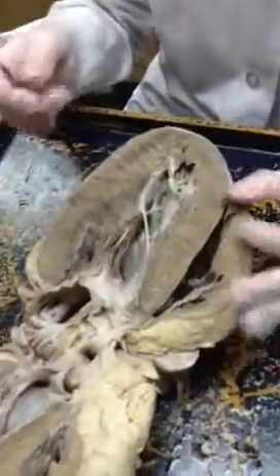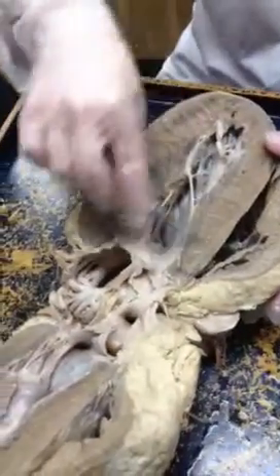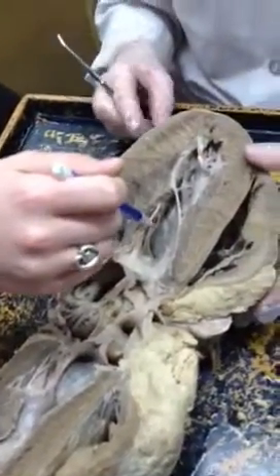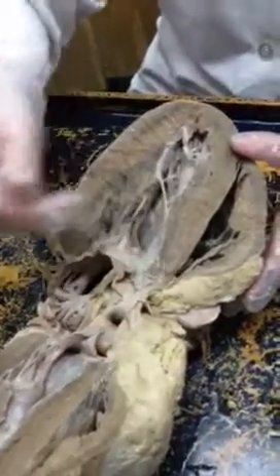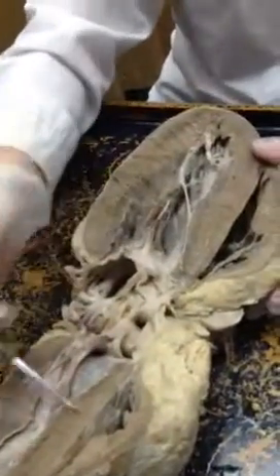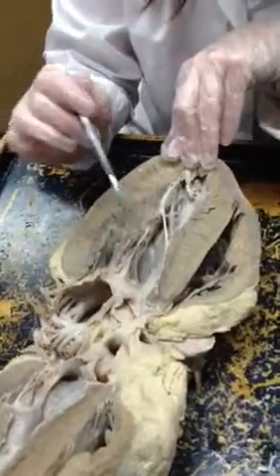When we open it up, you also have to be able to tell left versus right, because you'll have to identify specific chambers — left versus right ventricle and atrium. If there's a card that says 'layer,' we start there: epicardium, myocardium, endocardium. If it's pointing here it says layer — endocardium inside, myocardium middle, epicardium outside. If it's here but doesn't say layer, then we want the ventricular septum, and that's the only place it would not be a layer.